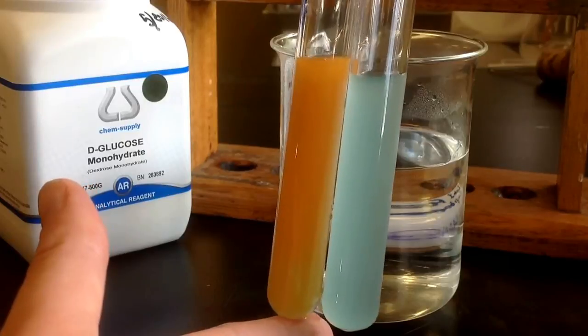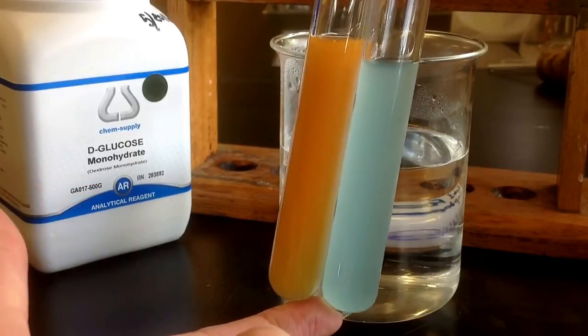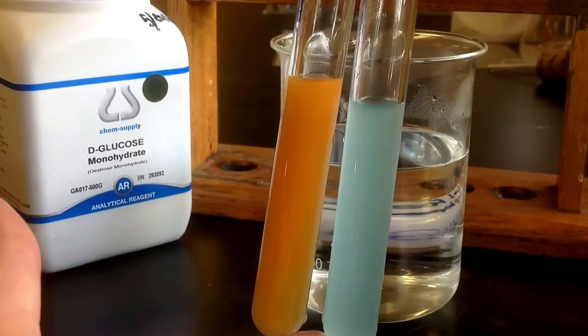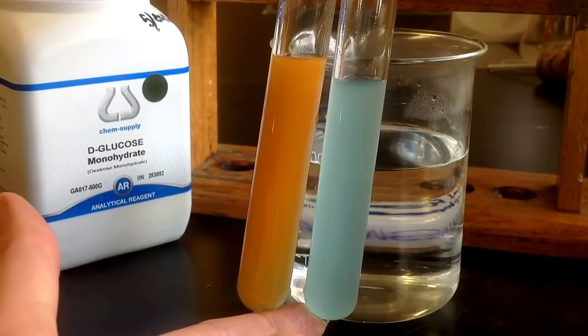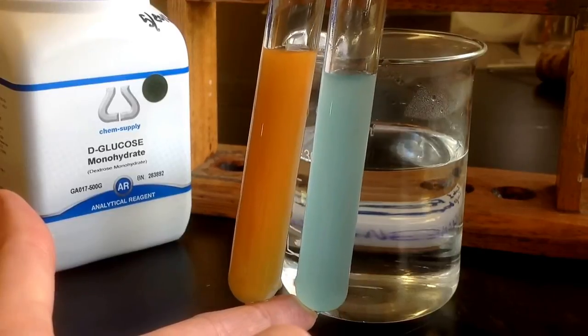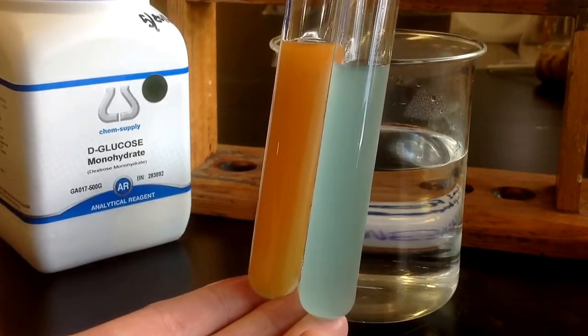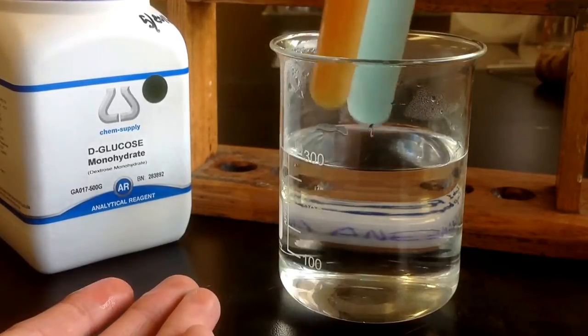So our solution's good, but there just doesn't seem to be anything to detect in there. And so if I do my calculations, the stoichiometry of this reaction with the measurements of the reactants that I put in, I might find that it's all been used up. Okay, cool. There's the test.